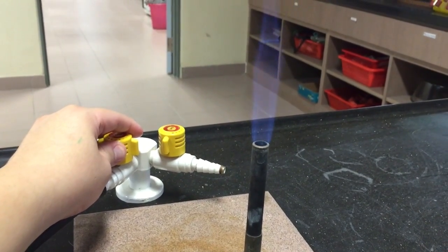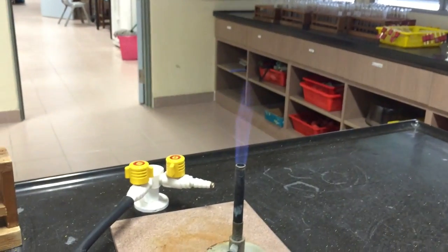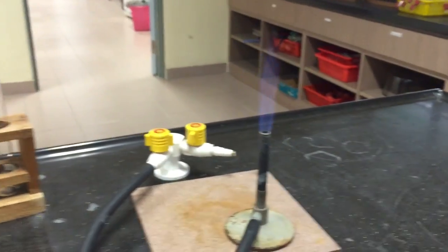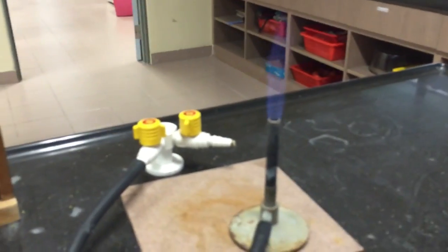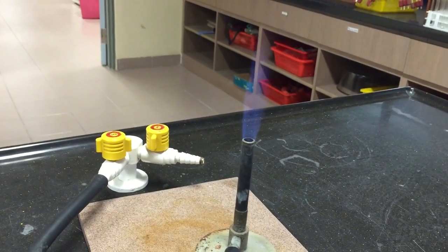We will first begin the heating by switching to a smaller flame for gentle heating. The purpose of gentle heating is to force all of the water of crystallization out of the calcium nitrate crystals. It's the first step towards performing thermal decomposition.